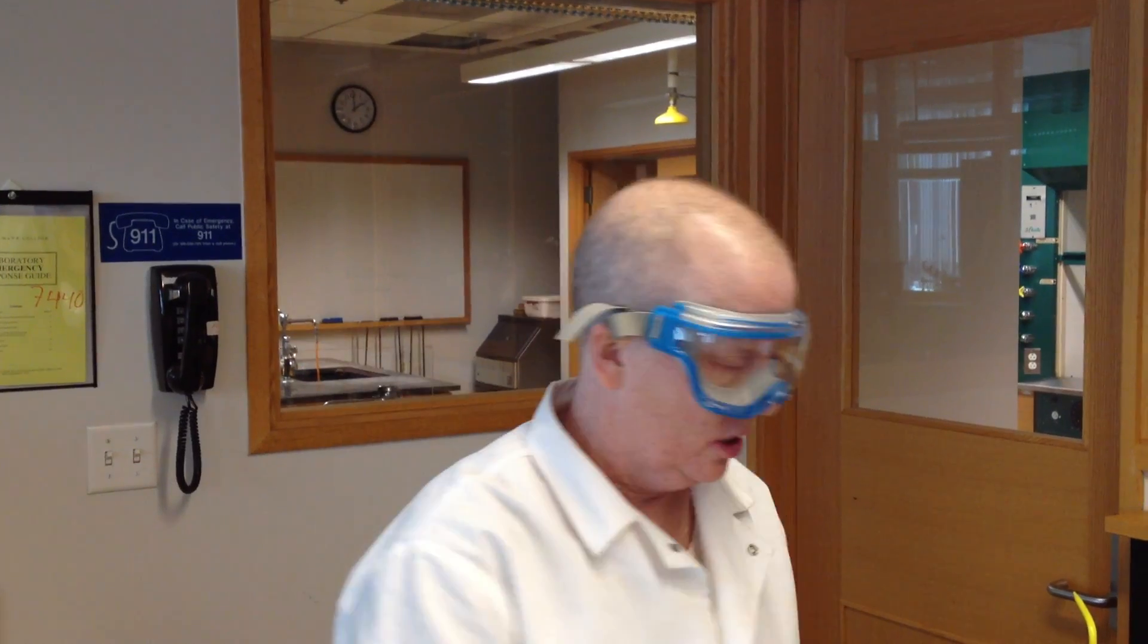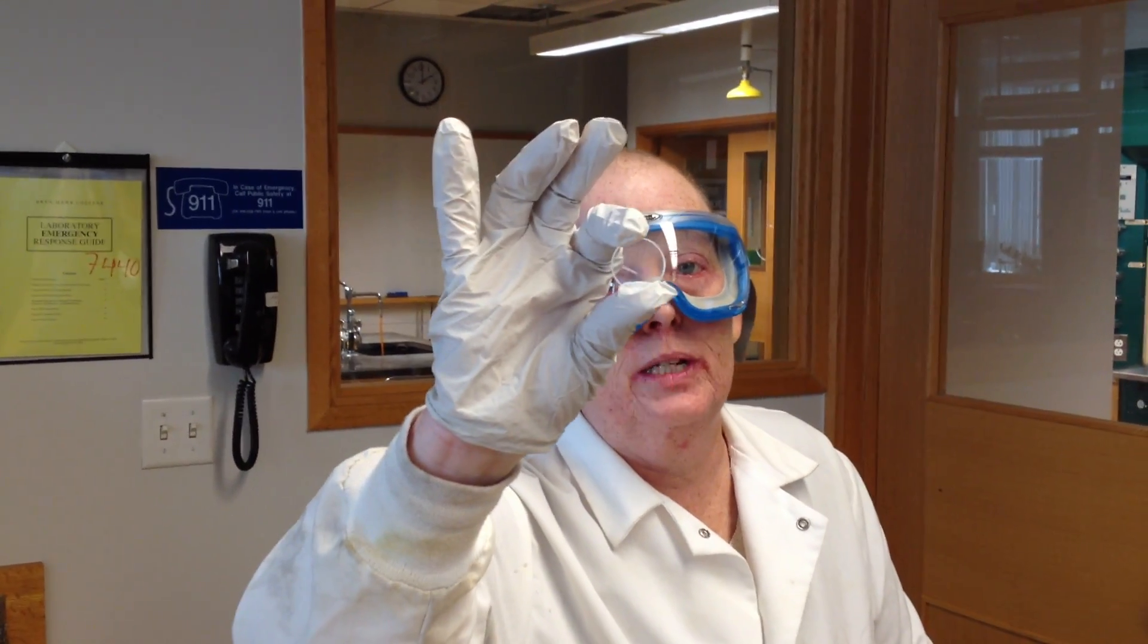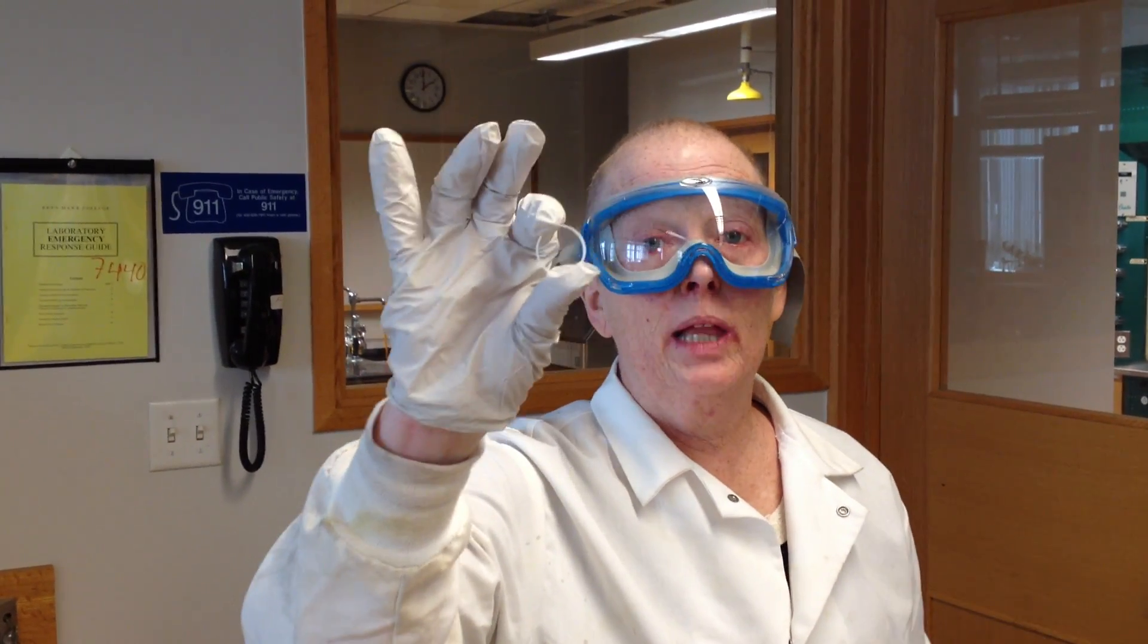These are sodium chloride discs. This is a relatively old sodium chloride disc, probably six months old, and it's all etched and dirty looking. They get etched because they get exposed to water, invariably, because student samples have water in them, and then some people just don't clean them properly. What these discs are made out of is sodium chloride that's been pressed at extremely high pressure. I want to show you what a new disc looks like. A new disc looks as clear as a window. It's already smudged just because I touched it.